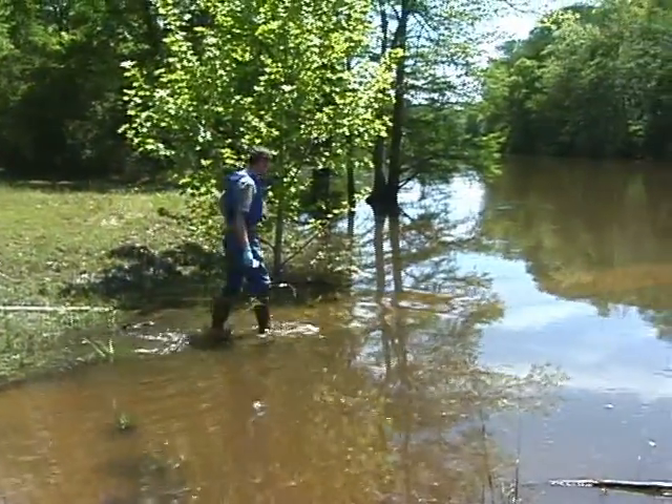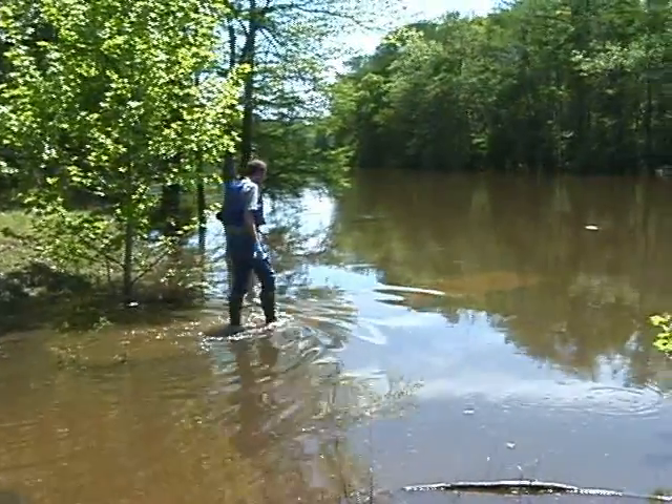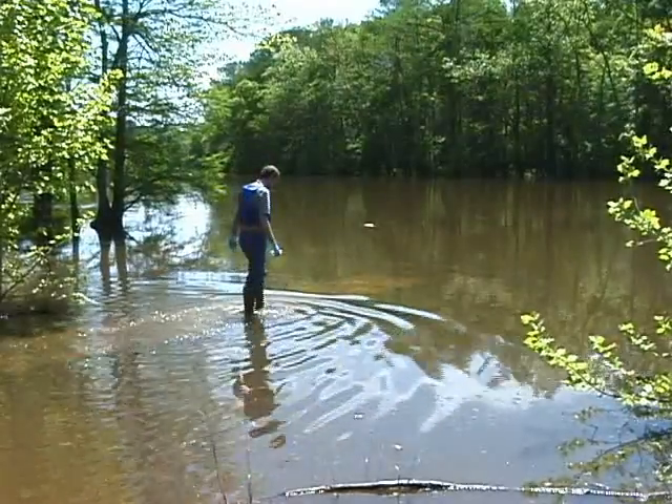Sampling does not require you to walk on water. It just requires a little bit of care and patience and attention to cleanliness.